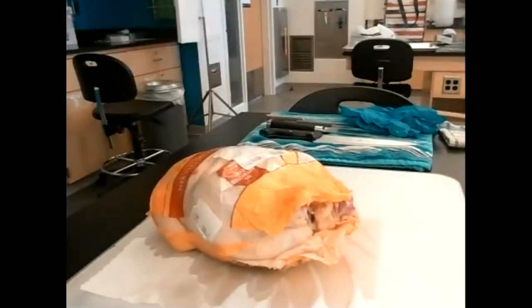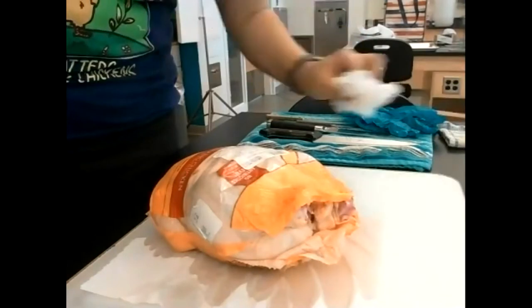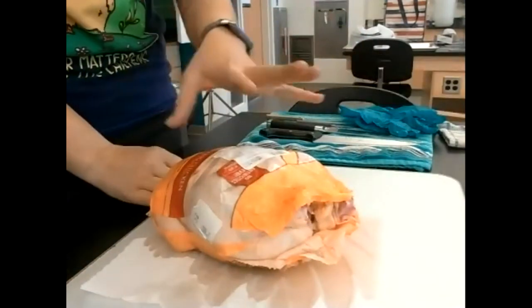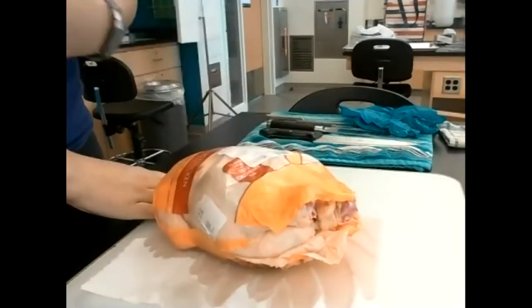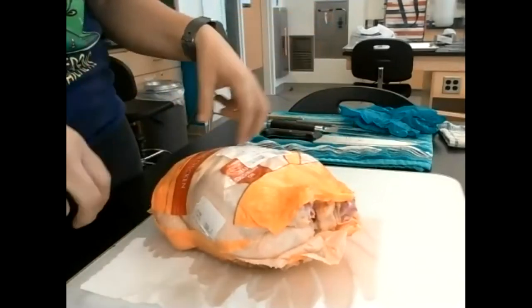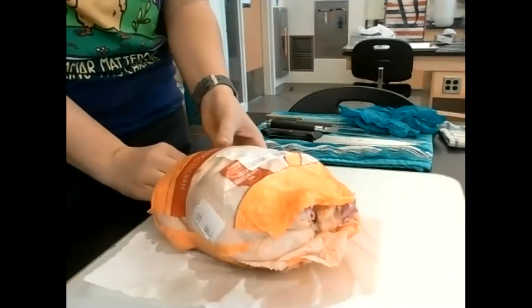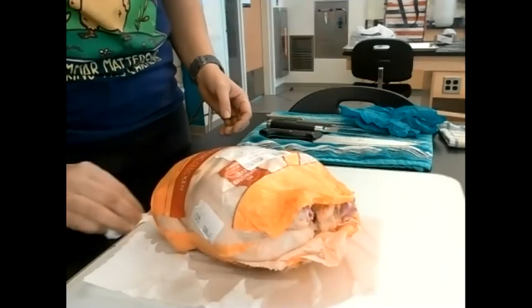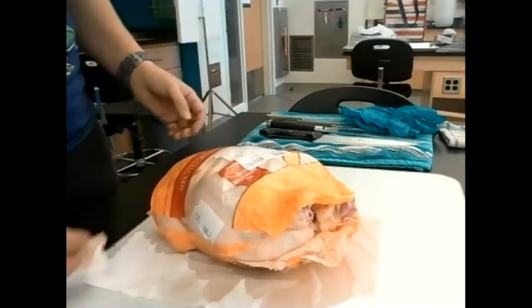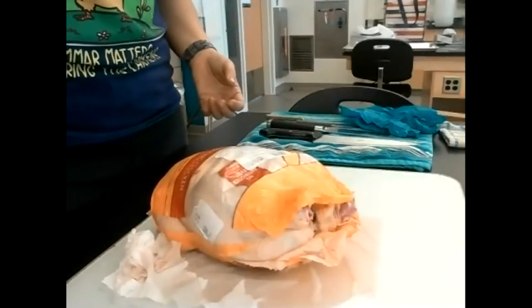Let's talk about the dissection itself. Of course, you need your chicken. I've purchased a whole frying chicken — also called a broiler chicken. I'll show you how to remove the leg from the chicken if you haven't gotten it already cut up. This is also a little life skills bonus — you'll learn how to partially quarter a chicken today.